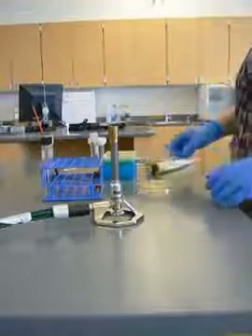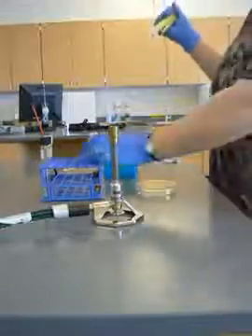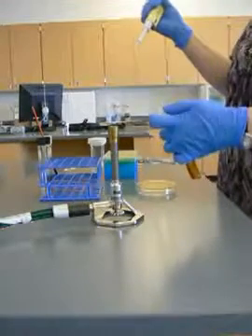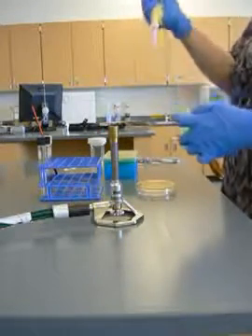I'm going to loosen my lid, and I have my plate. First thing I'm going to do, I'm going to come in here and get my pipette tip. Because I happen to be able to do this, I'm going to take this off without setting myself on fire, and I'm going to get 10 microliters.